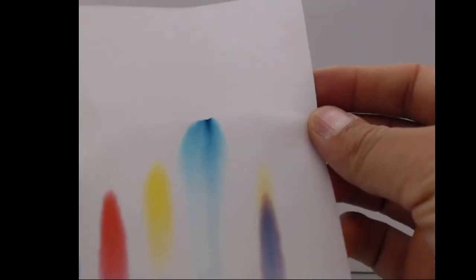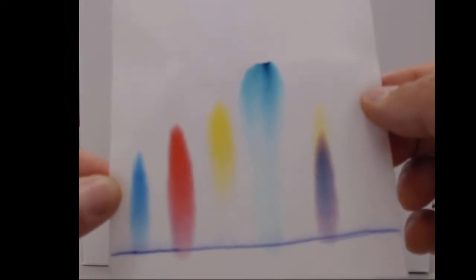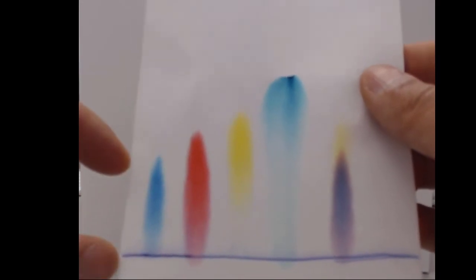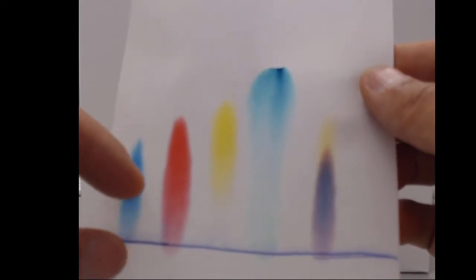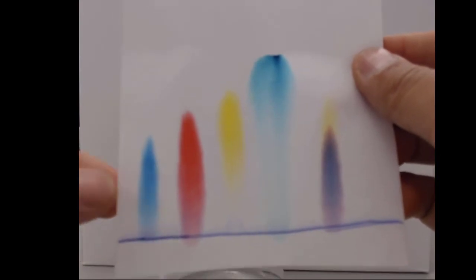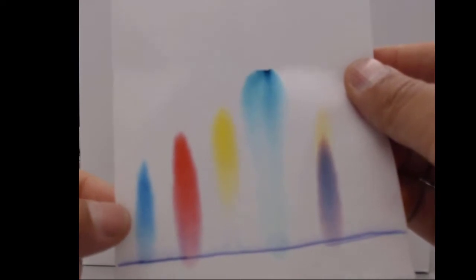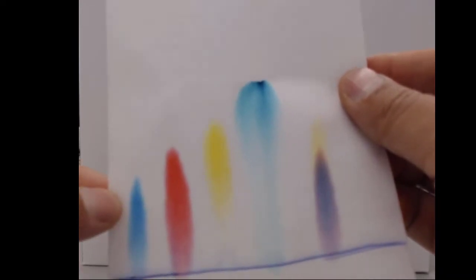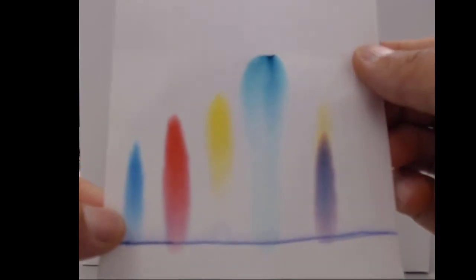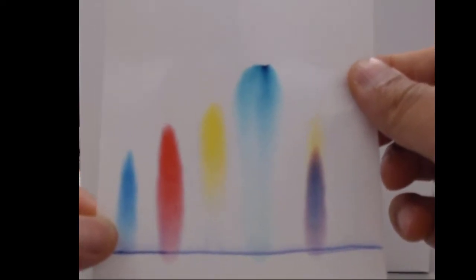The important thing here is that we can use this idea of a stationary phase, the paper, and a mobile phase, the water crawling up the paper, to separate out compounds based on their interactions with the mobile phase versus the stationary phase. That is to say, when we're looking at these interactions, we're looking at the intermolecular forces between the dye in the paper versus the dye in the water. And those differences in interactions are going to allow us to get information about the behaviors of the chemical compounds that make up each dye.